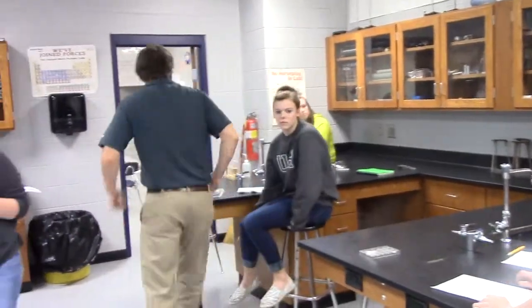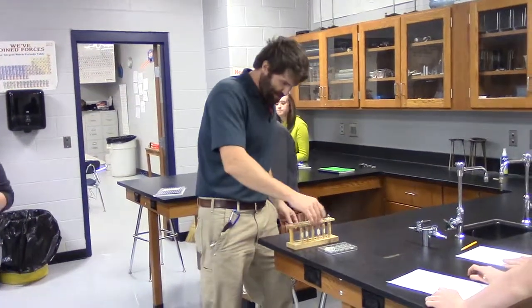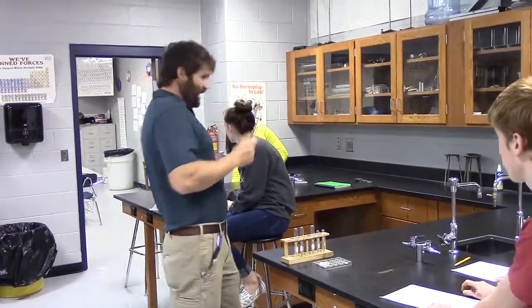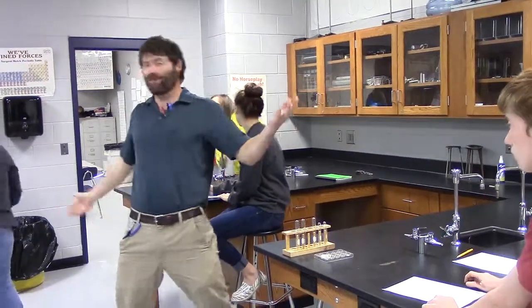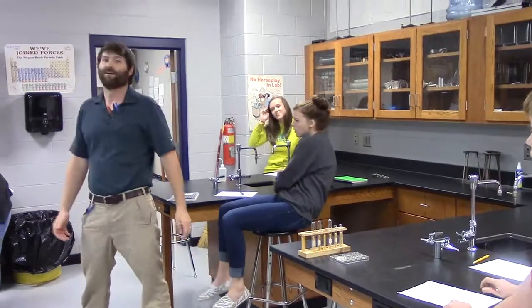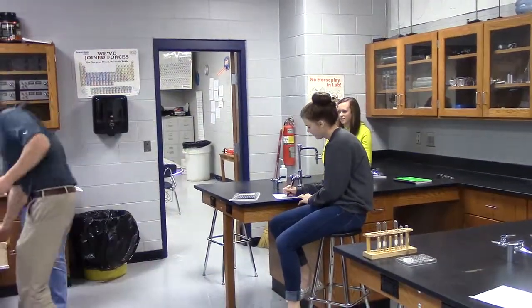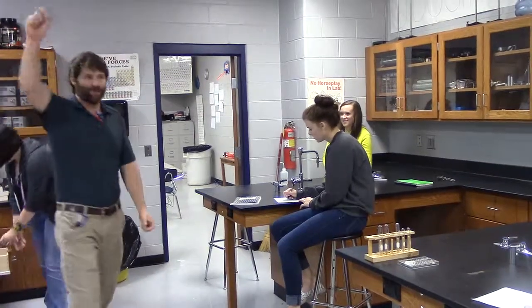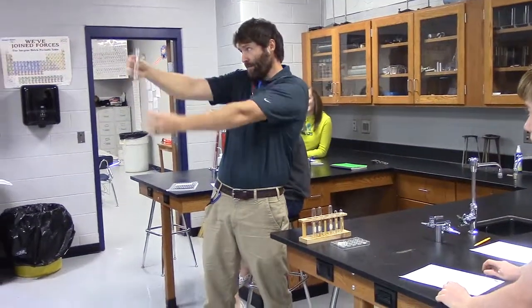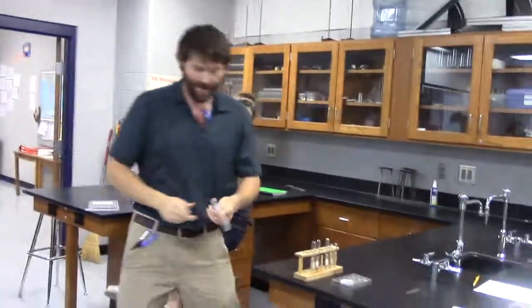I need my test tube rack. I also need my test tube tongs. Hannah, can you grab me some test tube tongs? Test tube tongs. Can anybody help me with test tube tongs? It's a hard knock life for me. Those are bigger tongs. Test tube tongs. Bam, I got my test tube tongs. I'm ready.